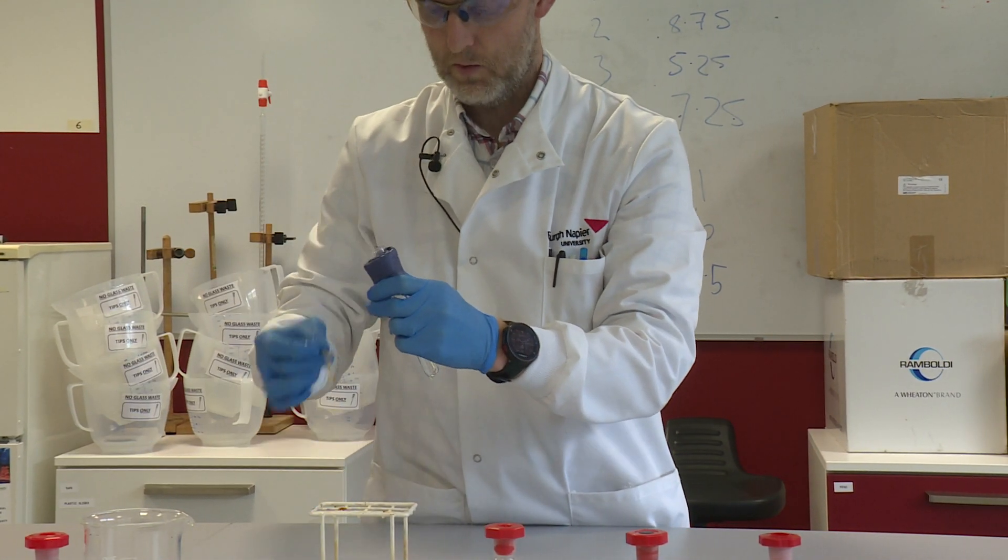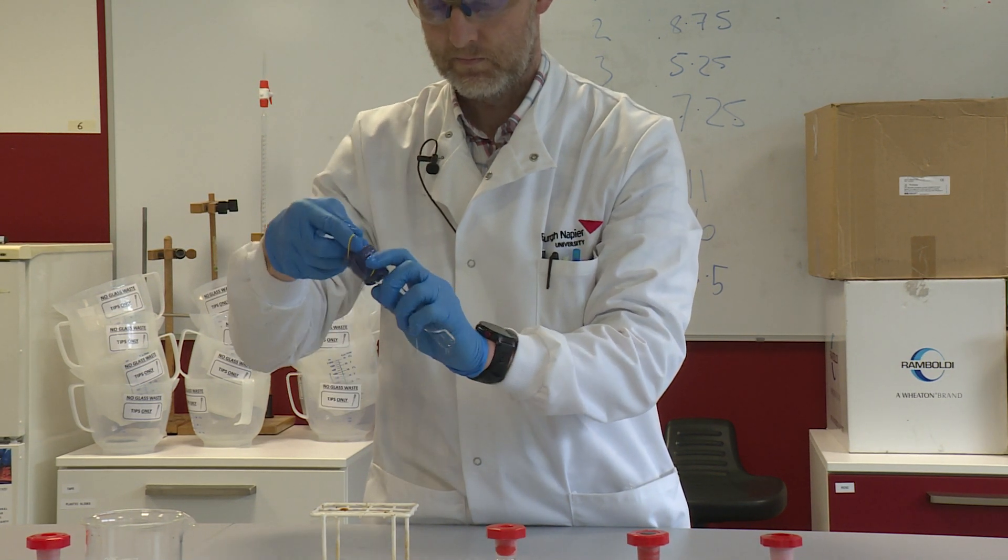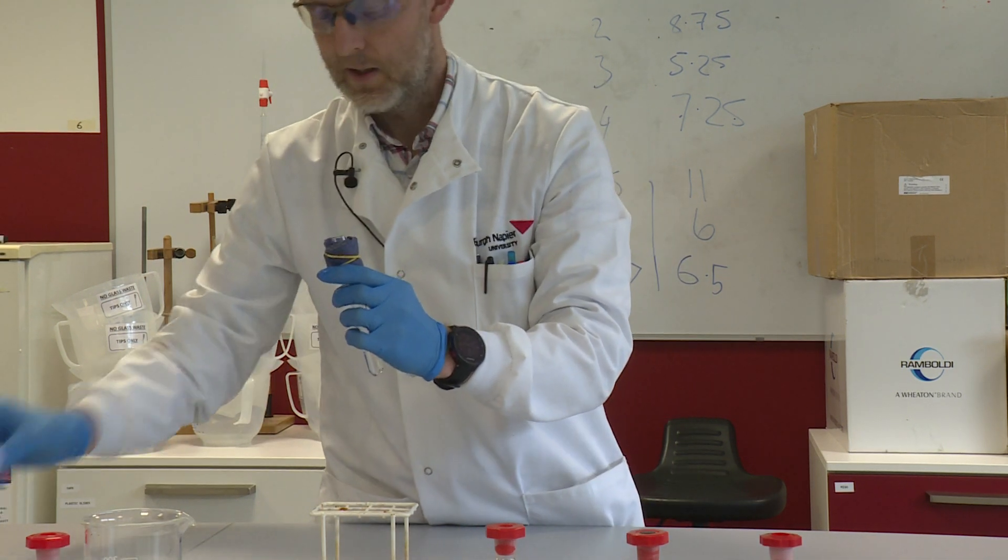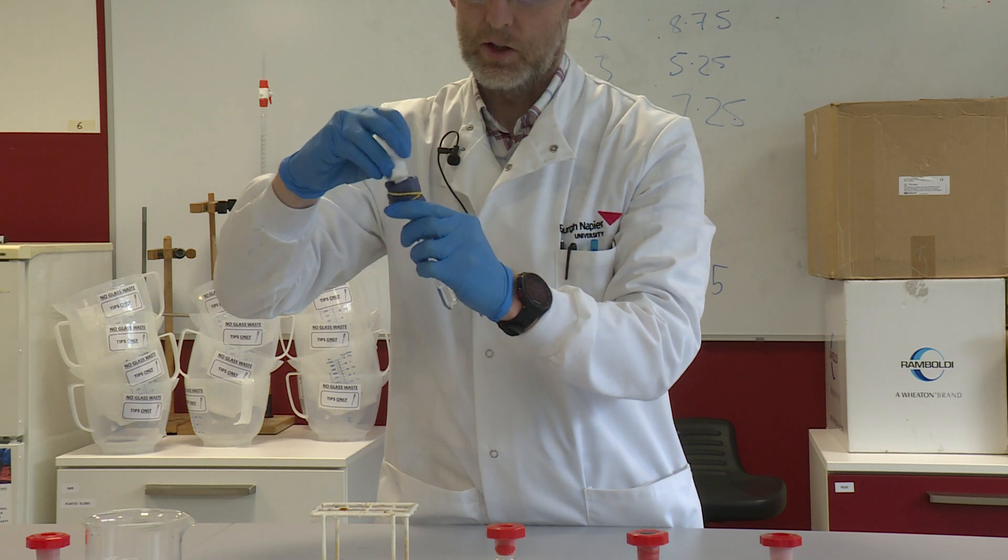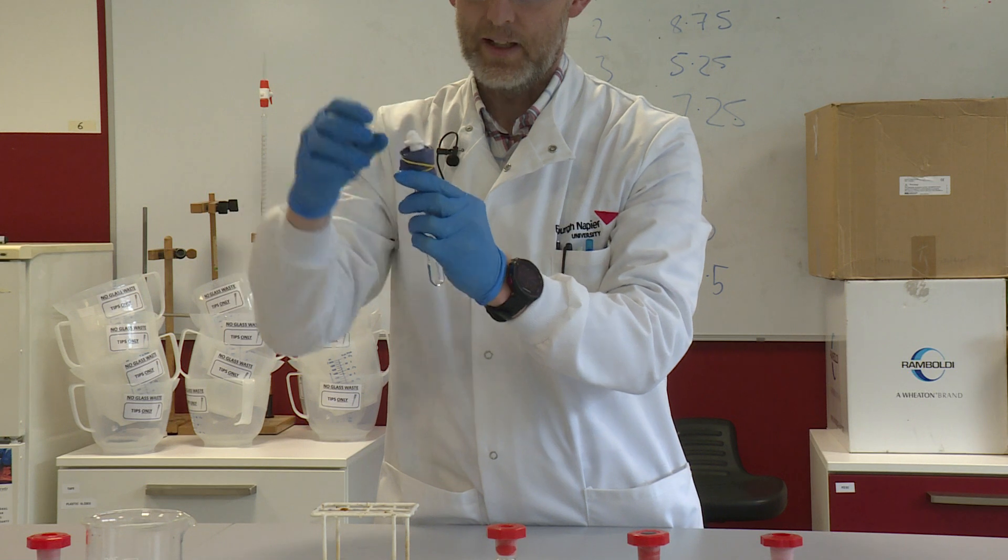I'm just going to secure that with an elastic band. Then I'm going to pop some cotton wool in the mouth of the test tube, so that if I pop it into the boiling water, it stops any of the reactants spitting out of the end of the test tube.